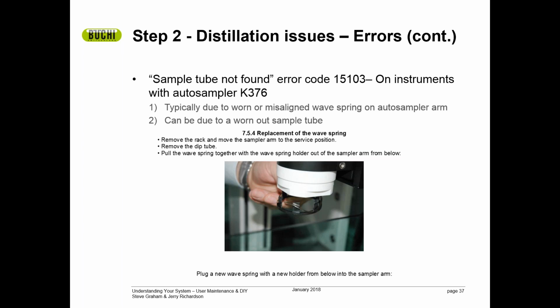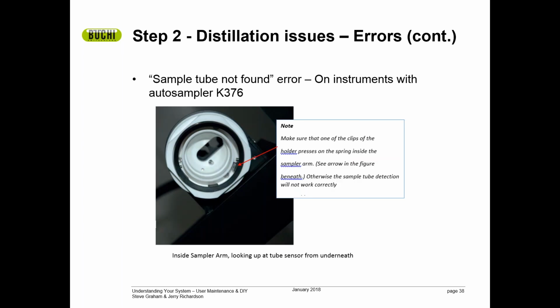In the following pictures, in this picture, we're seeing the actual sample tube and the wave spring at the bottom of the sample tube. On the next picture, we're looking up at the bottom of the sample tube arm. And this is a very simple process to change this wave spring. In fact, it is in the operation manual as a routine maintenance part. But the key here is to make sure that you get one of the spring members on that sensor spring that is depicted by the red arrow in this picture. Be sure to get it right there and you'll be good.